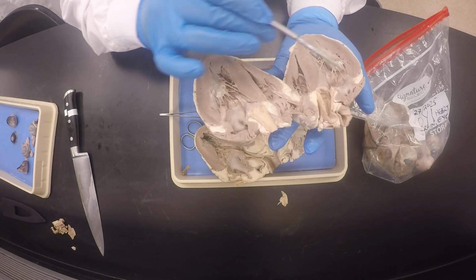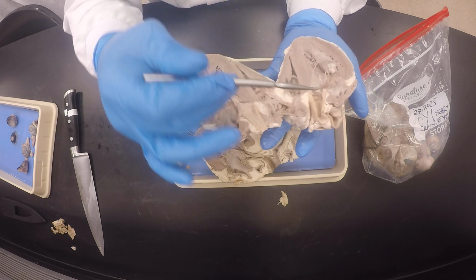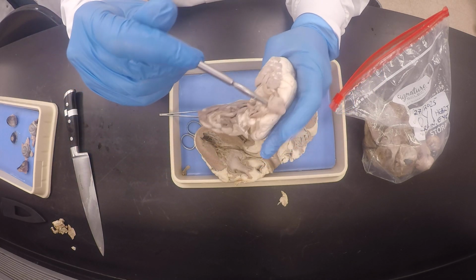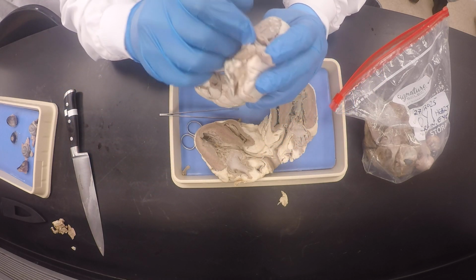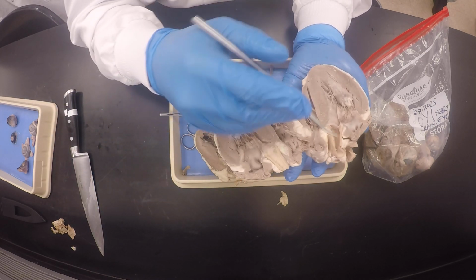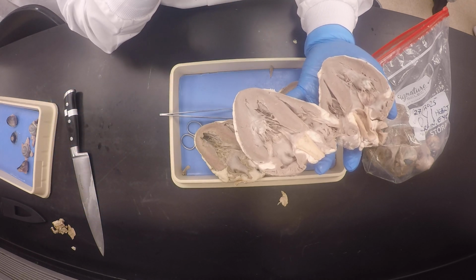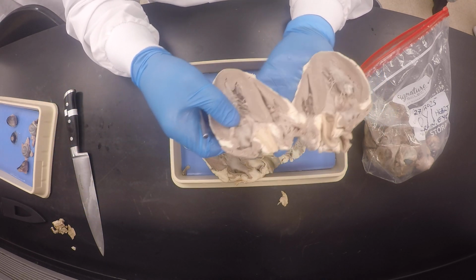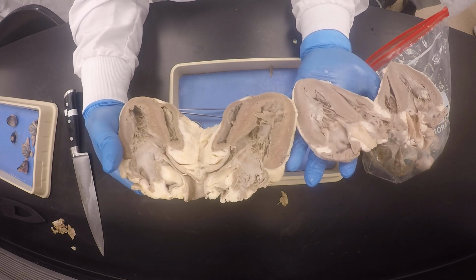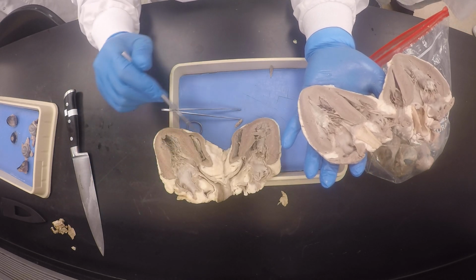Interventricular septum, bicuspid valve, tricuspid valve, aortic semilunar valve, and the pulmonary semilunar valve over here, inside here, because we had to cut it to be able to see it. All right, okay. And then of course this is the aorta, you could see that. And the papillary muscles, right? And that's it for the internal structures. With ours, it's just that we cut the moderator band, because it was contorted some way, but we would have seen it nicely.